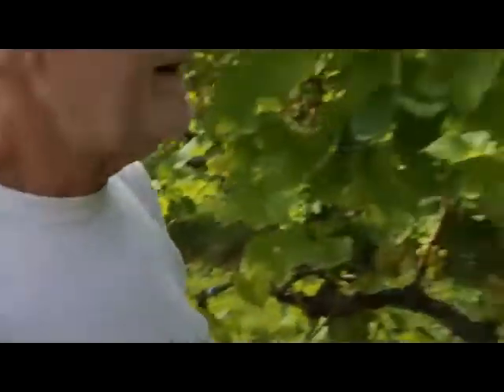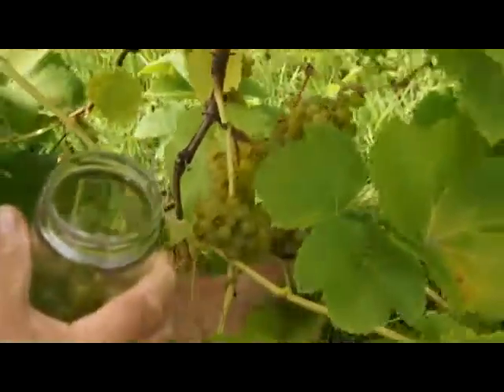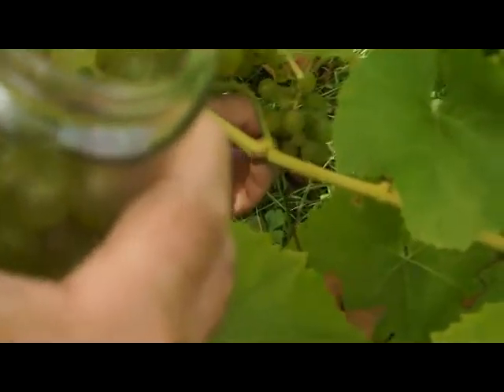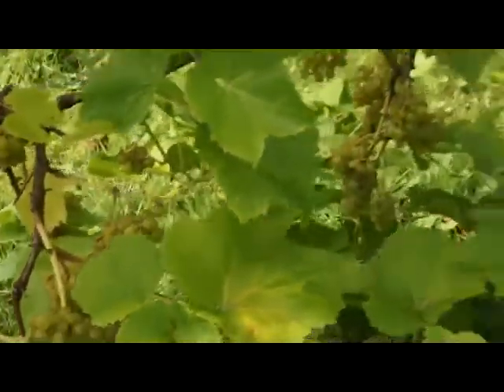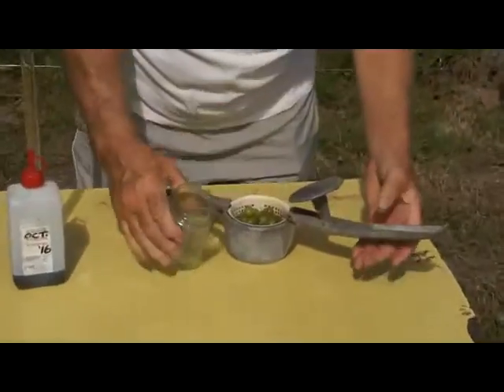Over here we can go. We'll take some from low down — there's some there. They haven't had much sun because they're behind a leaf. Let's try a few of those — there's four. Pop them in. All right, we've got to fill it out. Put them in.